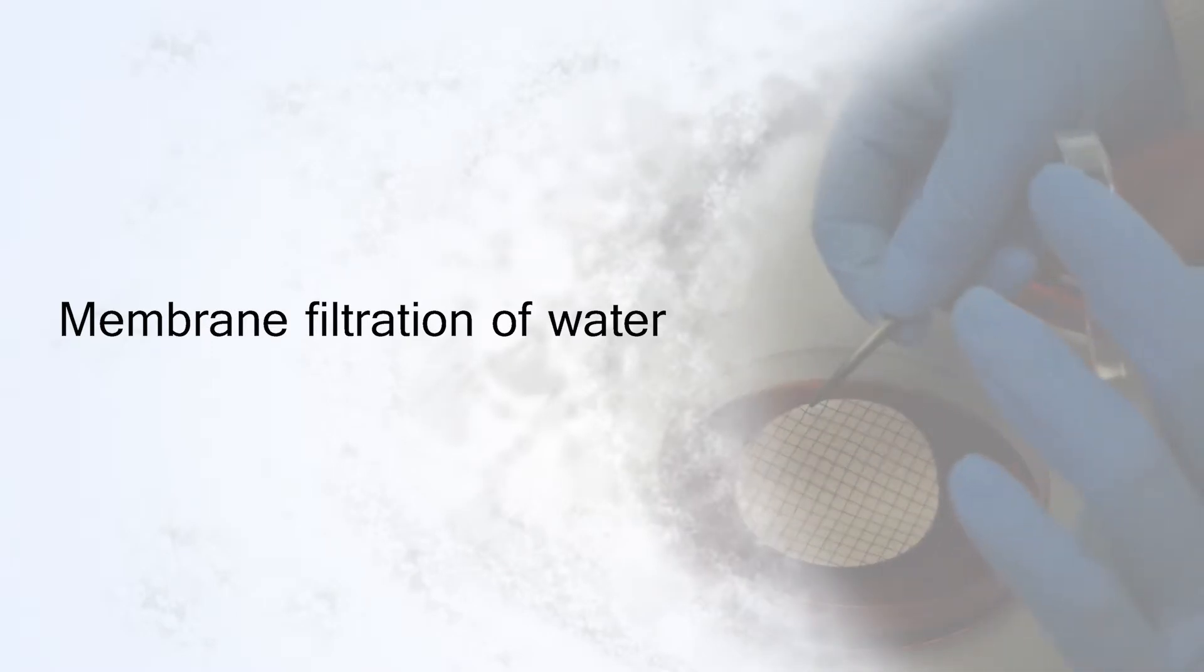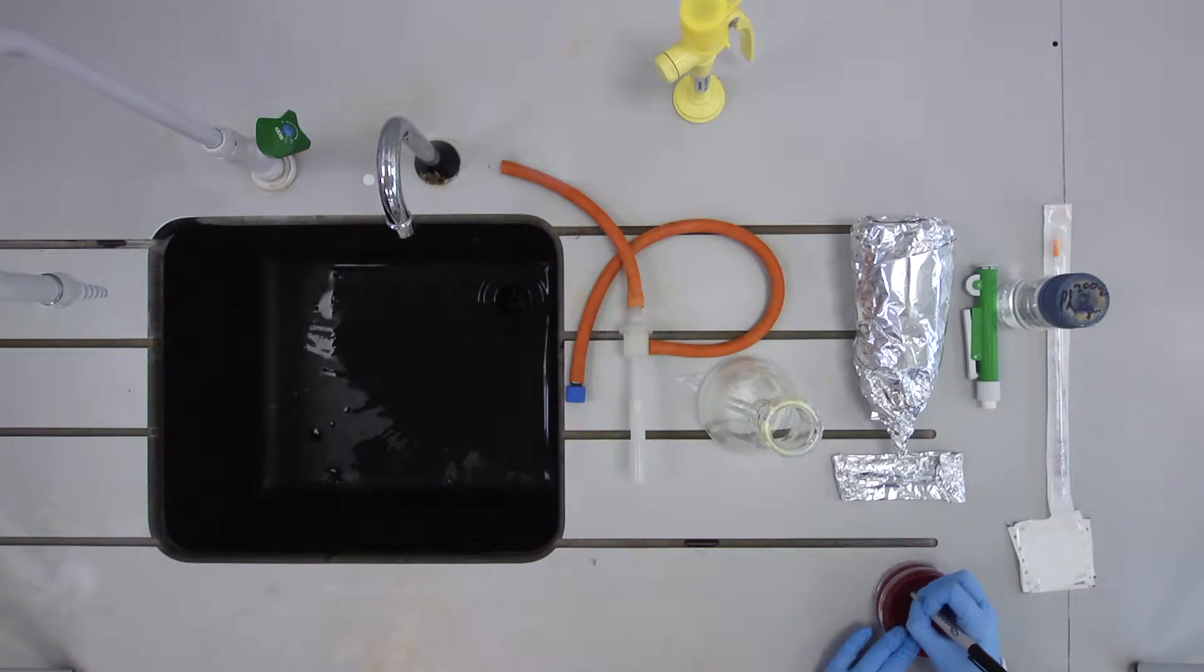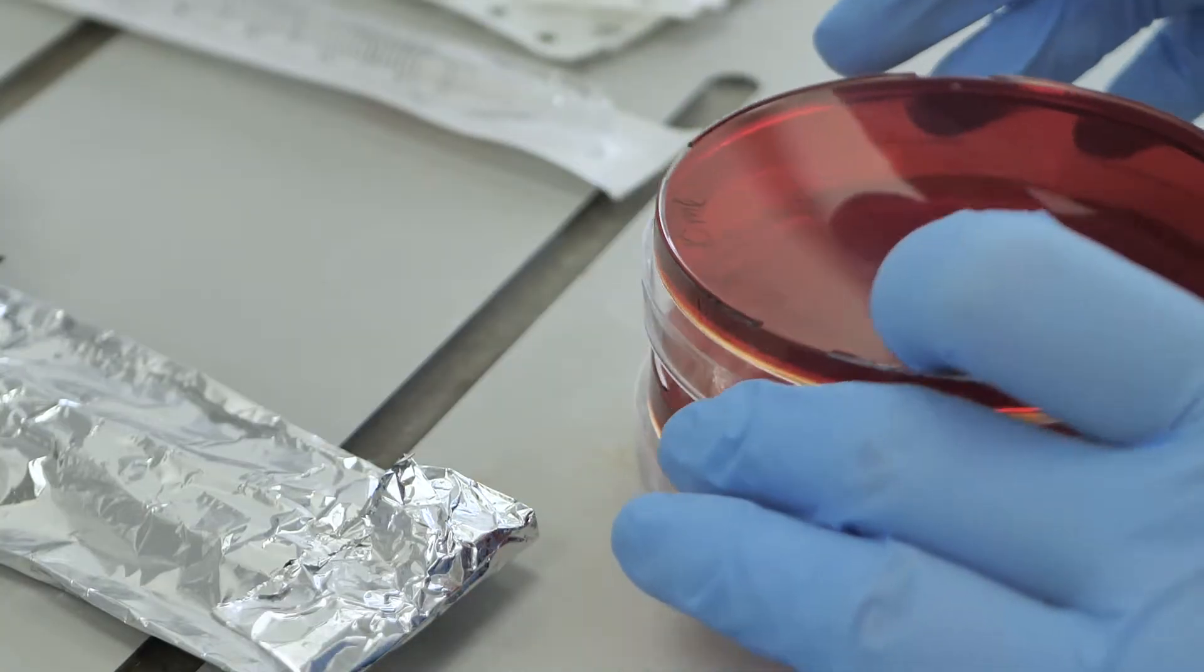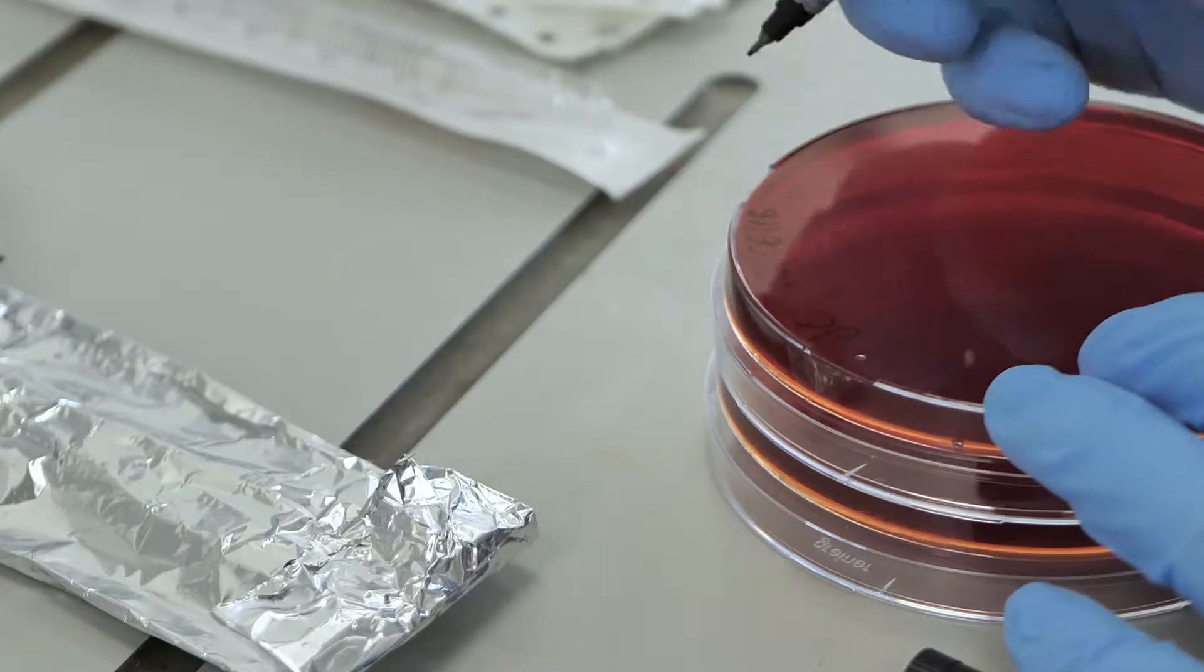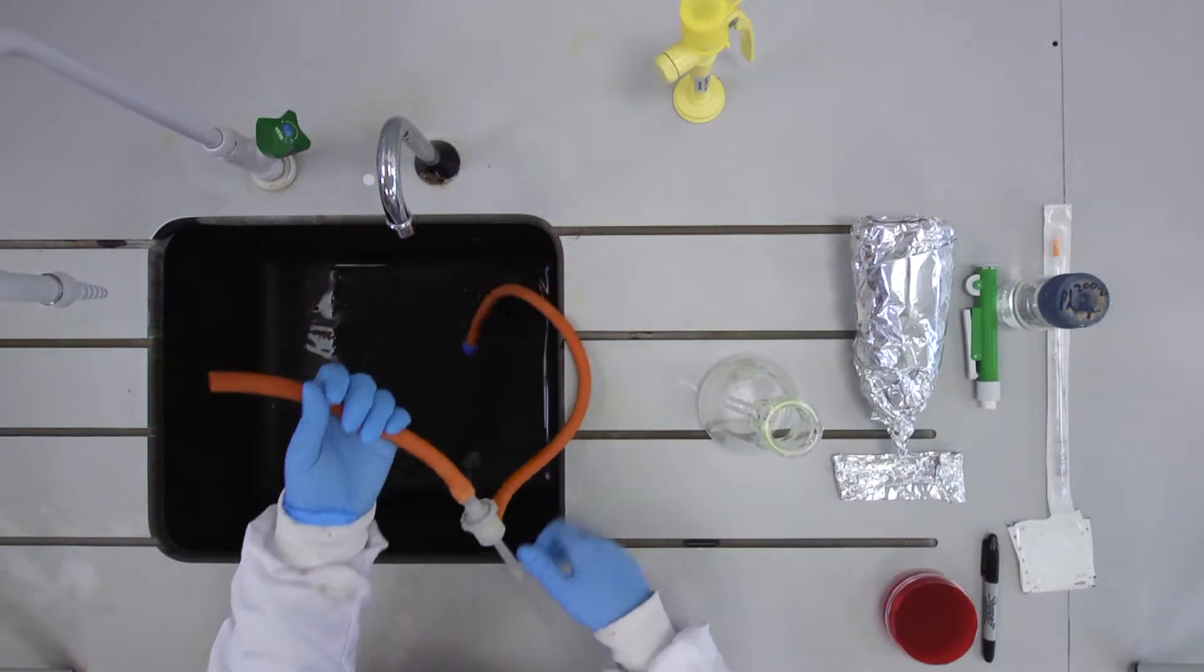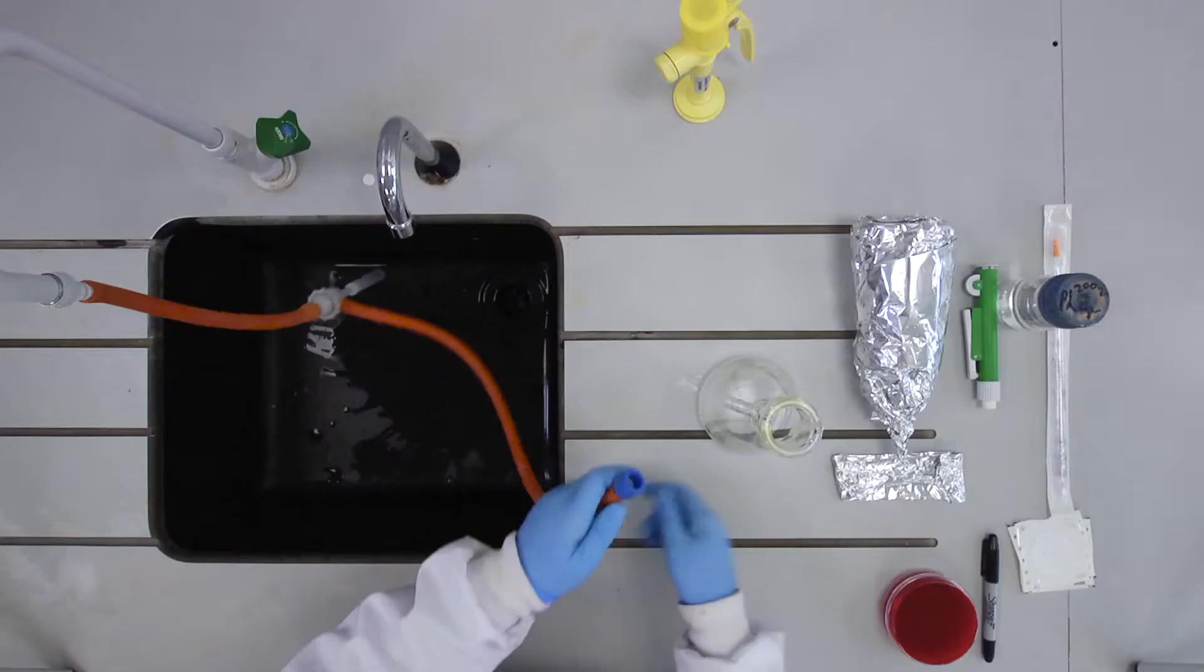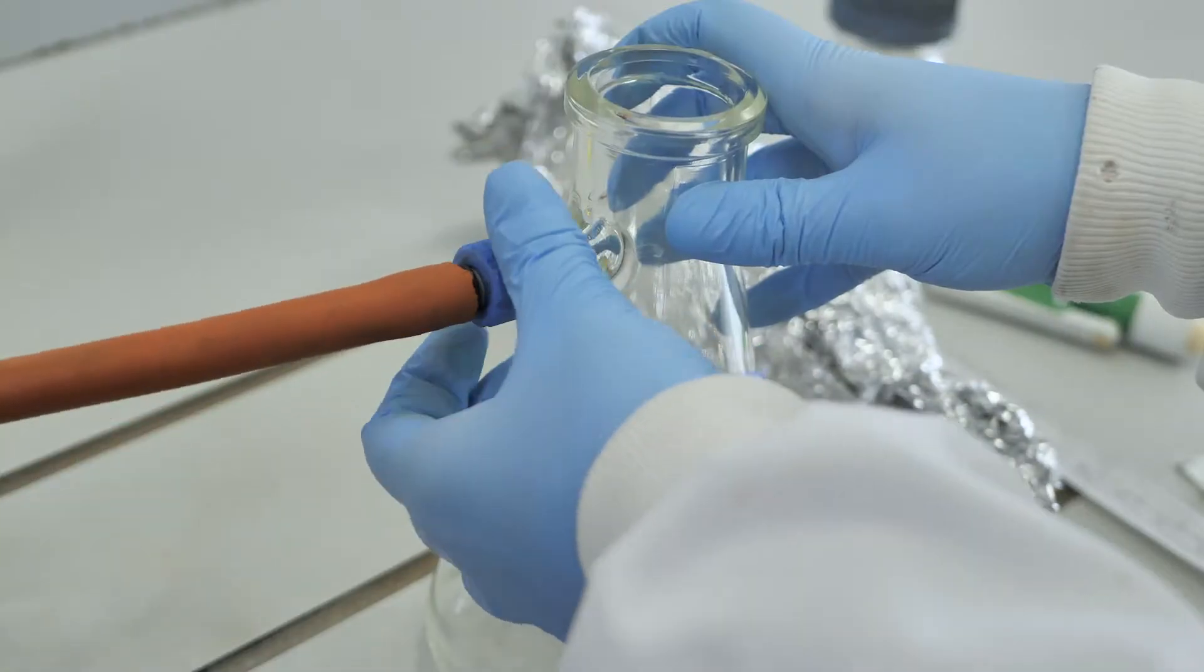Membrane filtration. Label the bottom of each plate. This experiment is conducted close to a sink due to the use of a Venturi tap vacuum pump.